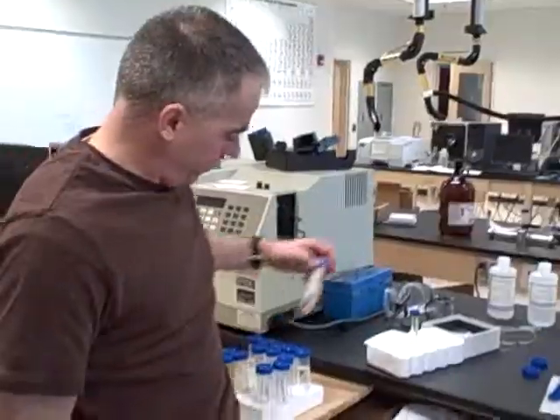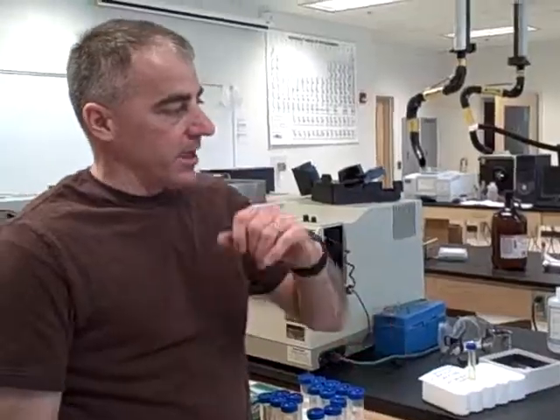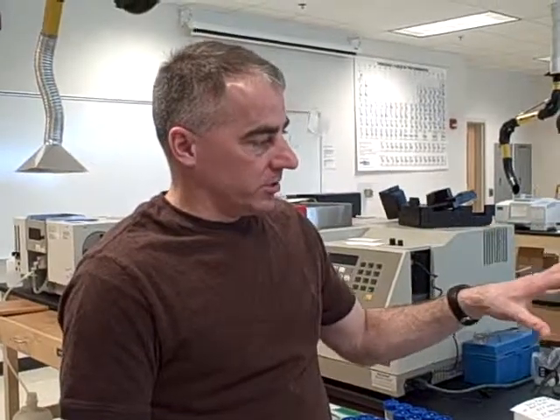Samples in the auto sampler. Whatever, they just fit in the rack. We'll calibrate off a standard. So the system's automated. We'll just go to each sample and do the analysis fully automated. You don't have to sit here and change the pump or whatever.